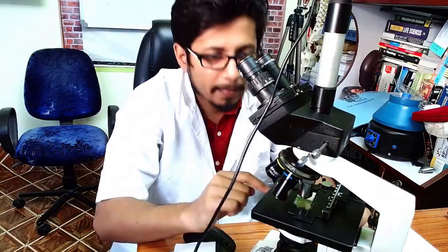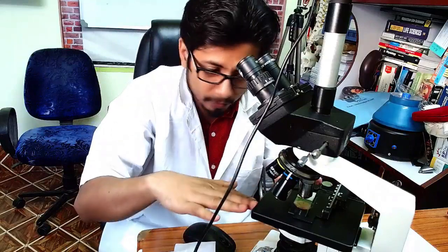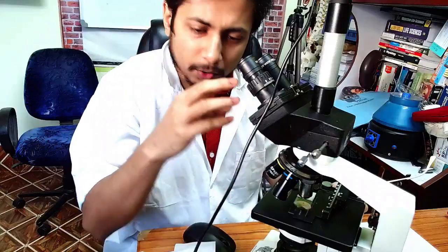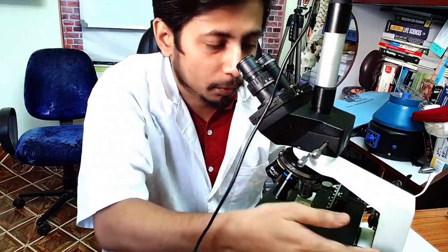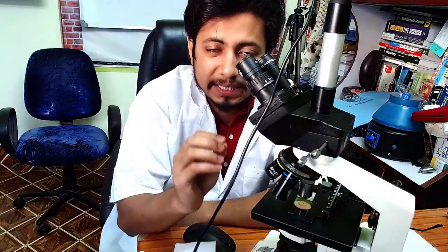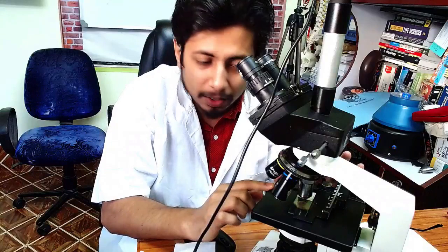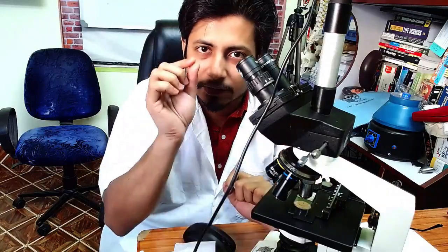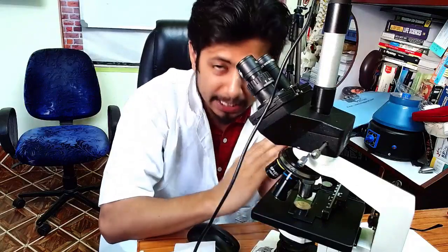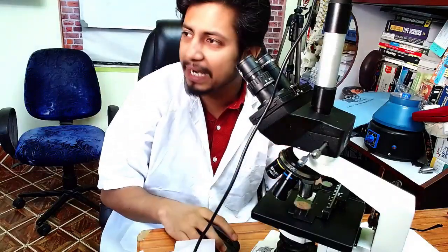Many people put their eye to the eyepiece and then start moving the stage up, rotating both the coarse and fine adjustment screws. This is the biggest mistake you can make when focusing a microscope, because there is a chance the objective will hit the slide and crack it. Although there is a spring mechanism in the objective lens to help protect it, the objective lens can still acquire damage.